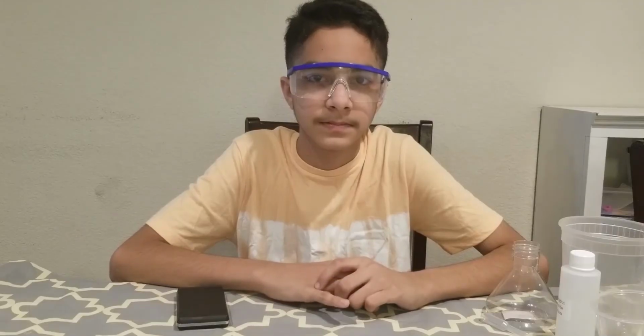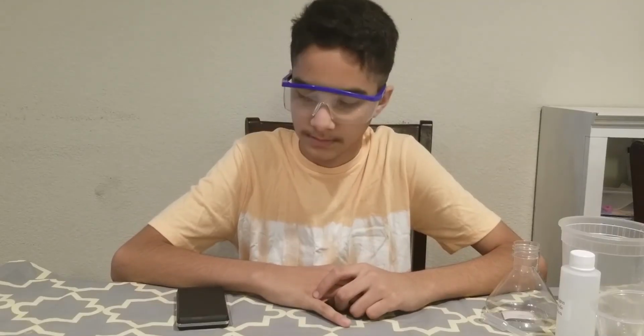Okay, Shahyan is going to help us demonstrate the gas stoichiometry lab. Let's see the equipment and supplies needed for this lab.